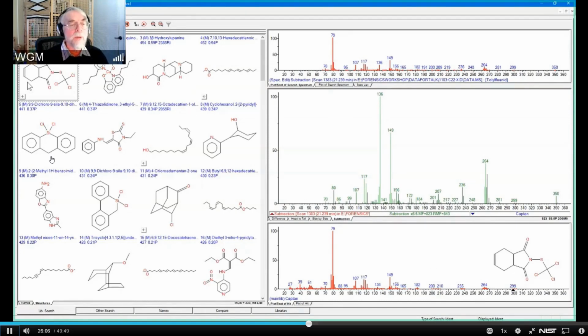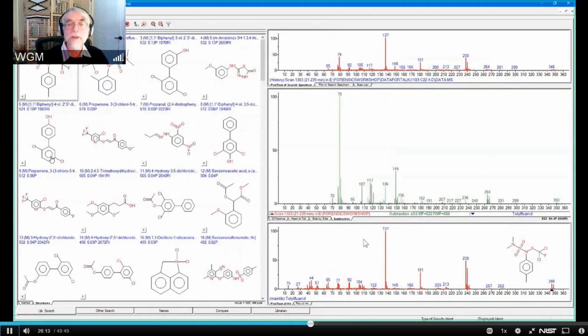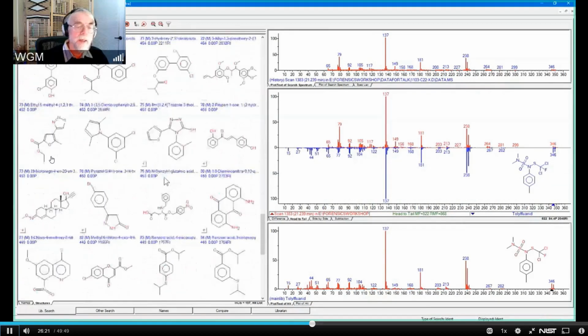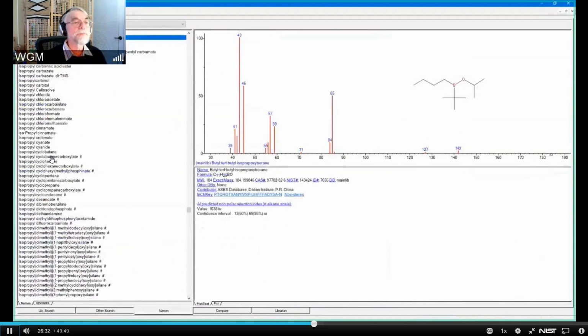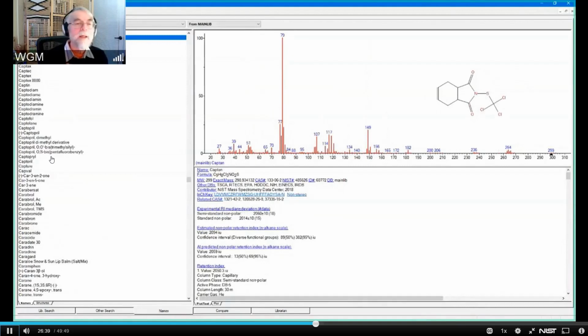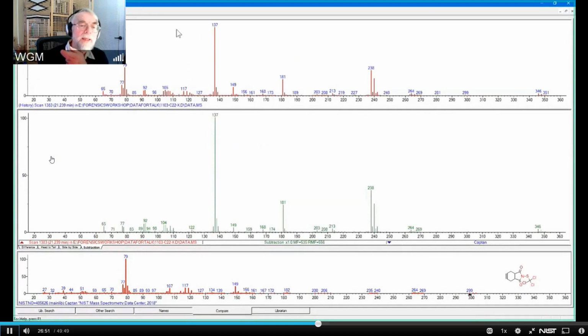Now, one thing I would like to do is go back to my original scan, subtract captan from this, and then research that. Well, if I look down this list, I don't see captan anyplace, so I can't readily do that. To illustrate how to do that, I'm going to search in names for captan, CAPTAN, and now I've got a spectrum for captan. I'm going to send that spectrum to the compare list. What's already in the compare list, because it's the last thing I searched, is the history, and it's that single scan.